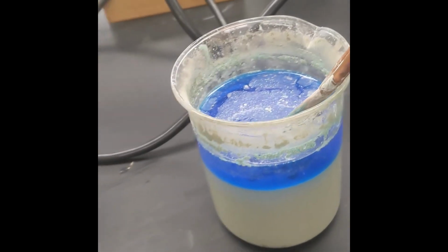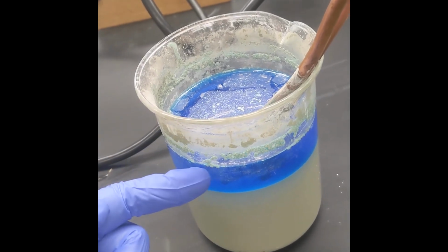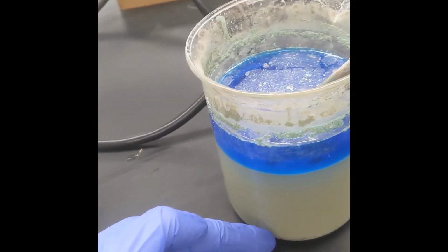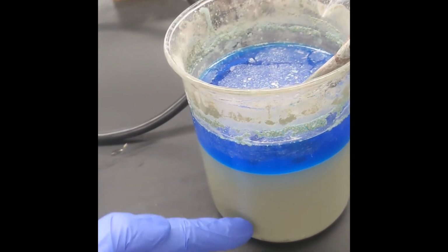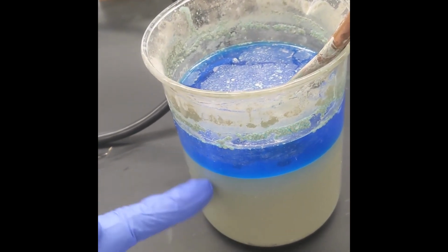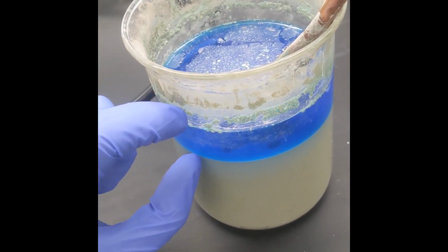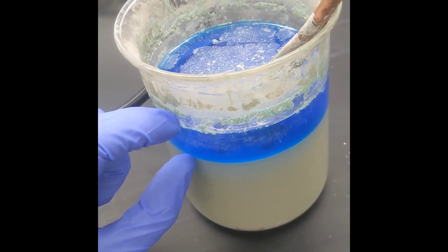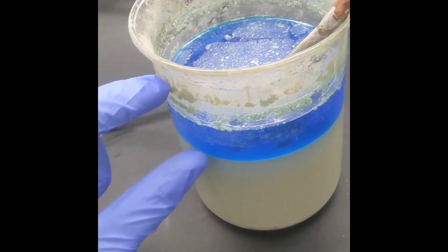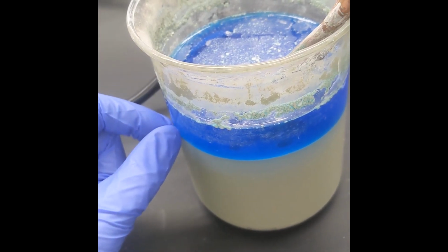It looks like overnight this is stratified, so floating on top is probably leftover copper silver nitrate, and then on the bottom is probably fully reacted, or at least mostly reacted silver, a very fine powder, a colloid maybe. And so what I'm gonna do is just decant this top part as best as I can, and then I'll filter it off. I'll combine the remaining liquid with the blue part, and then I will try and see if there's any silver left in there.